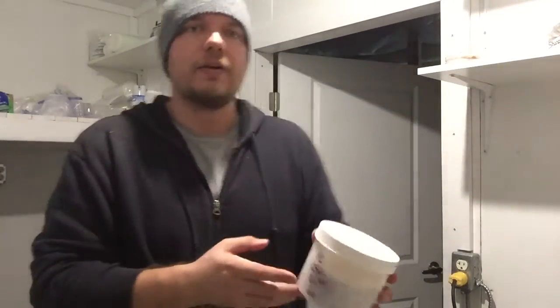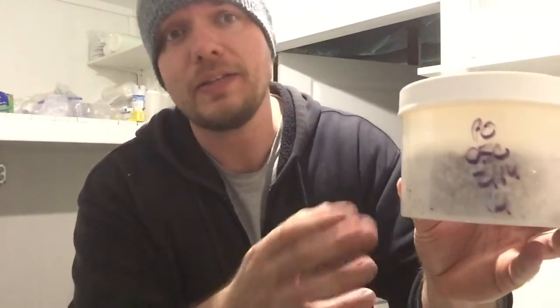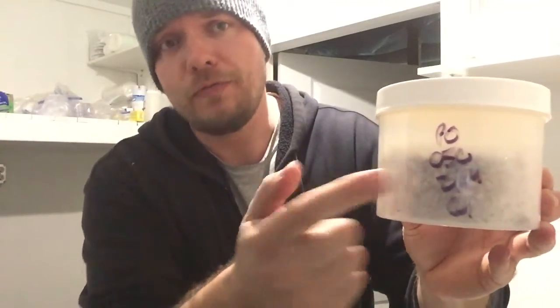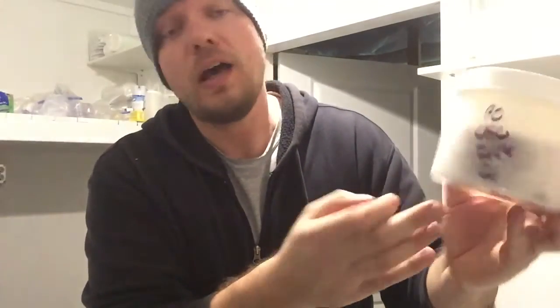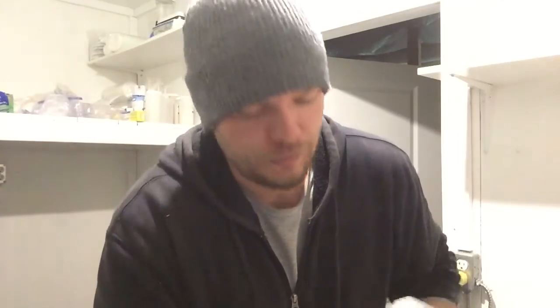I do have an example here. So again, we'll label the strain. So PO stands for Pleurotus ostreatus. This is our local strain from Oliver, strain 50. And then the date it was inoculated, this happens to be February 14th. And we always call these first generation. So this is our first generation transfer into grain jars. And then after this gets expanded into a grain bag, which we call a second generation. And then we usually stop the transfers at that point, and then the bag of grain will go into our final transfer into supplemented wood chips.